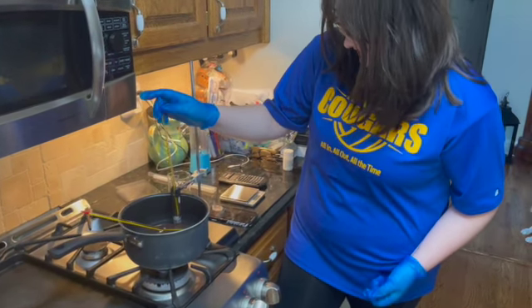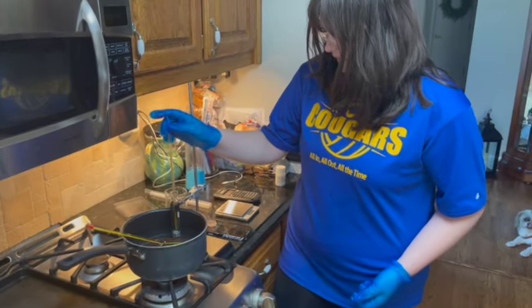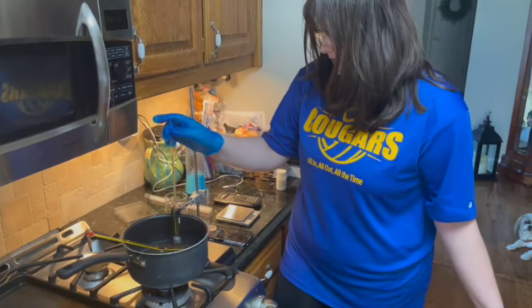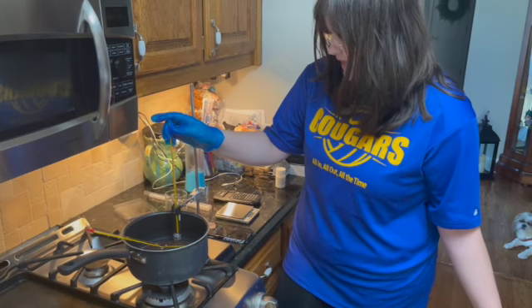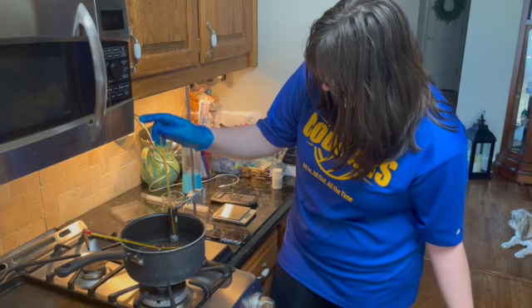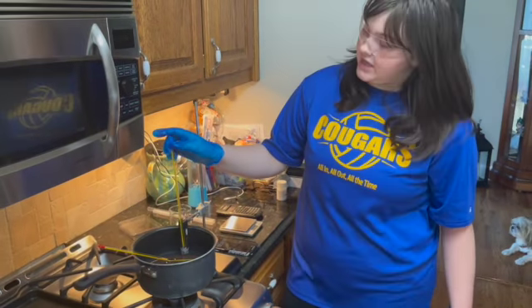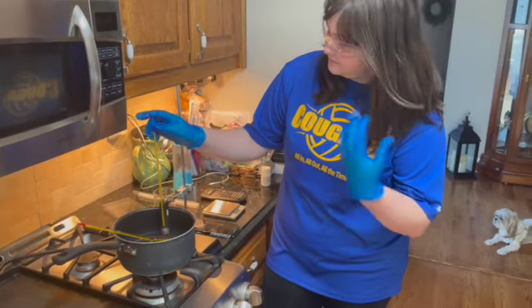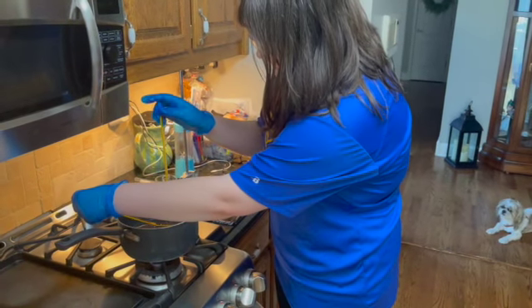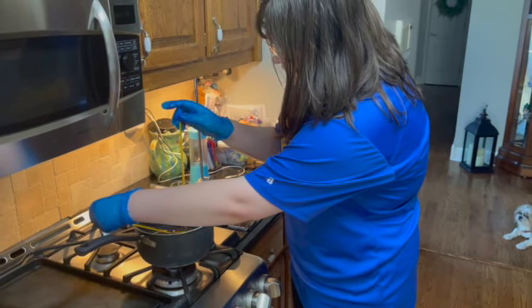I do not know what else to say during this. But what is happening right now is that we are just waiting for the solvent to melt. And we are at the 2-minute mark, and it has already risen to 40 degrees Celsius in the solvent. And rechecking the temperature of the hot bath, it is still at 54 degrees Celsius.